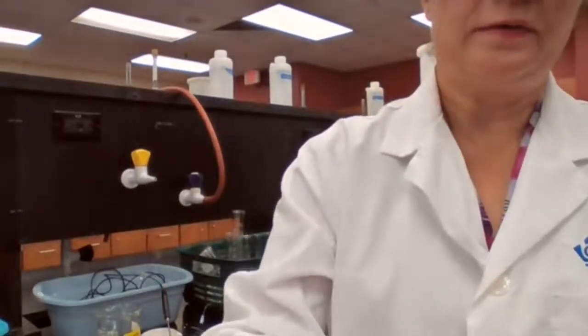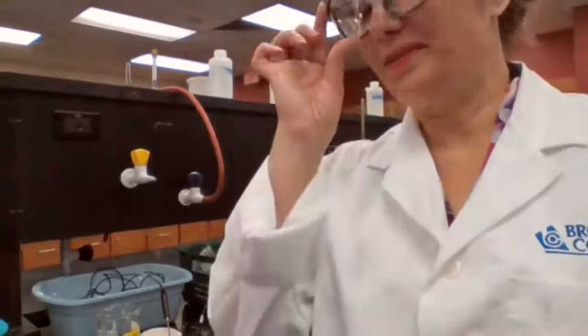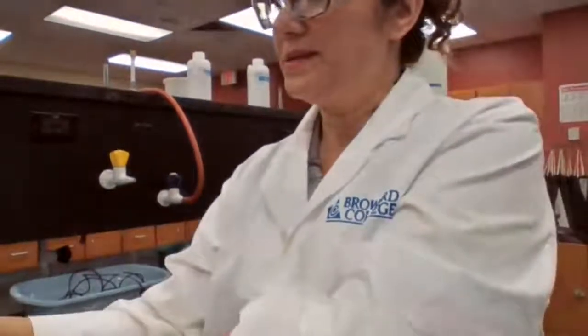That's 159.5 milliliter. Volume of the flask. First and second trial, they are the same. The only thing that was different for first and second trial is the mass of the vapor, which you are going to calculate. Just make sure that you are going to record those numbers in proper place in the table.